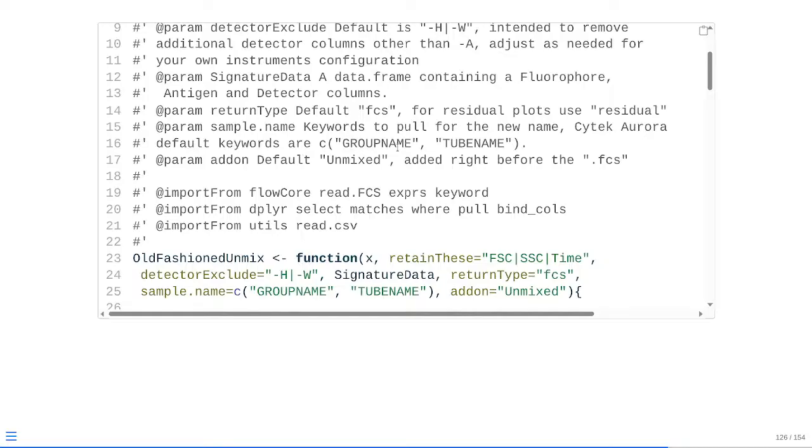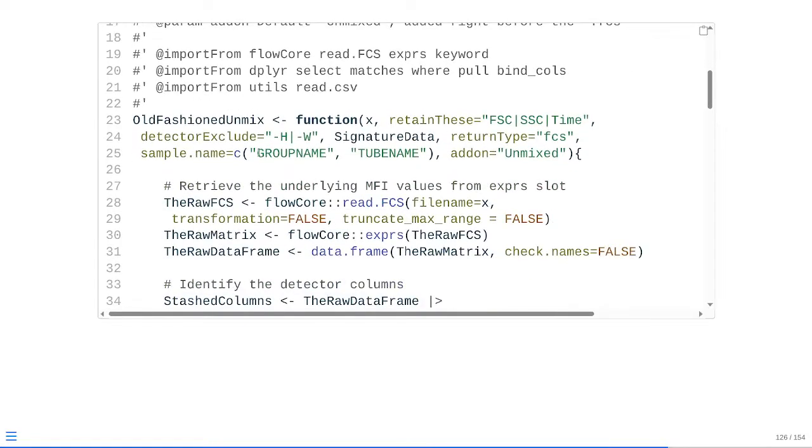So, what this is going to look like, we have two new arguments, so sample.name, which has some defaults of group name and tube name. So if you're not on a Cytek Aurora and you don't have these keywords, you would need to change the argument respectively, but it's on the argument side, so it's easier to do. And then in terms of the add-on argument, the default is going to be unmixed, and it just tells you it's going to place it right before the .fcs. So at that point, you can see defaults being specified accordingly for those two arguments.